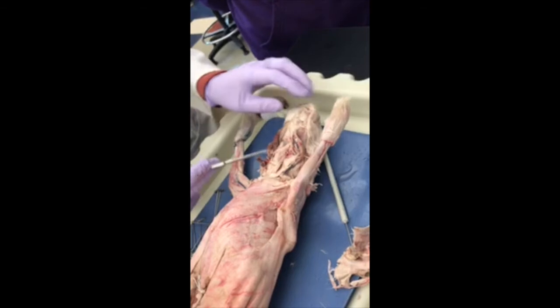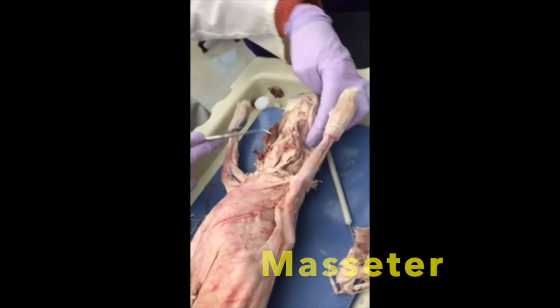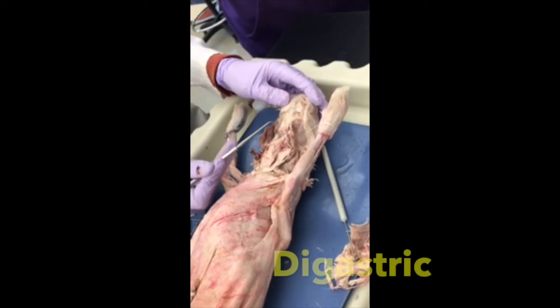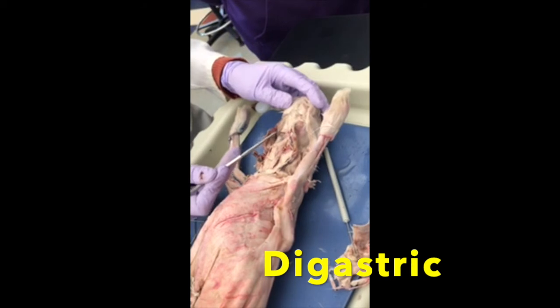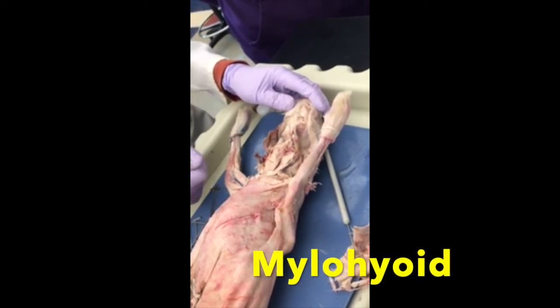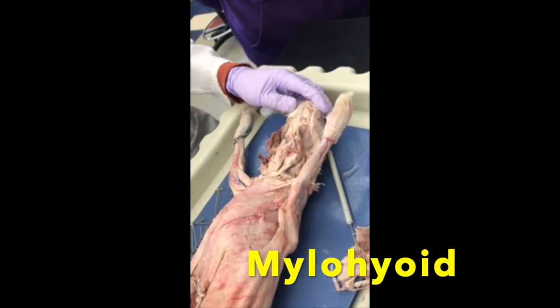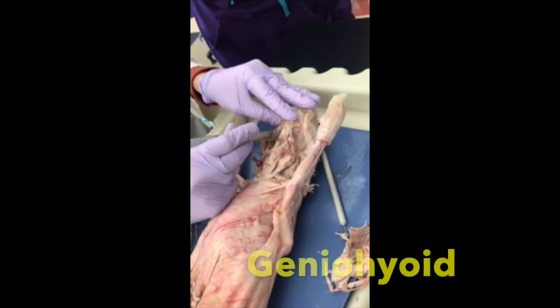Okay. Further up here is your Masseter. Okay, the Masseters are on the jaw. These are my Digastrics. They're on the lower part of the jaw. Okay, and then this guy in between the Digastrics is my Mylohyoid. Okay, and then the last little guy is the Geniohyoid.